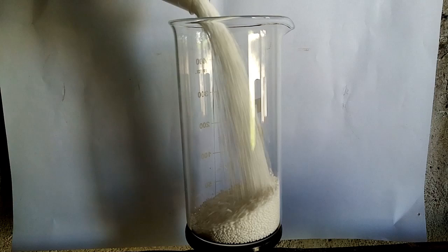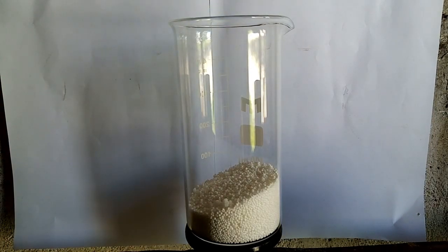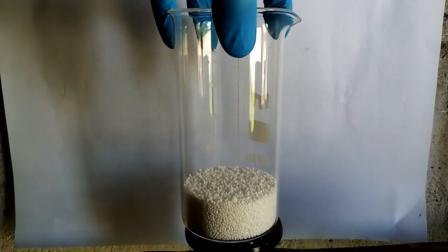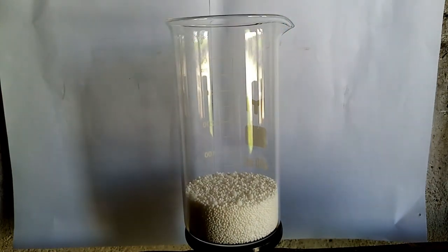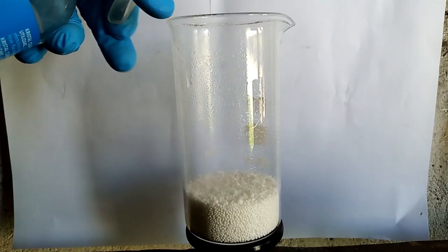The reason why I use calcium nitrate is because in the reaction calcium sulfate will be produced and will be insoluble in the environment, making the nitric acid much easier to filter.